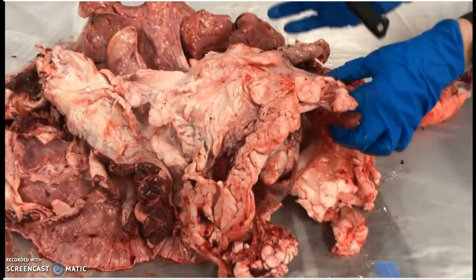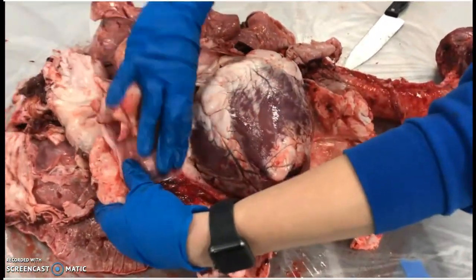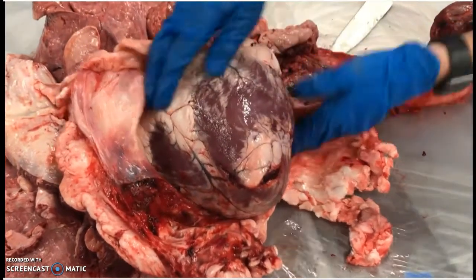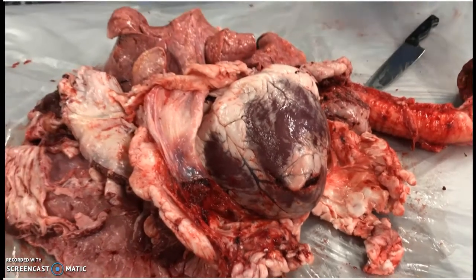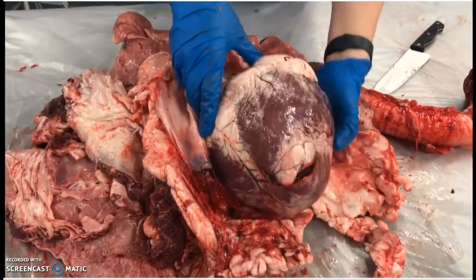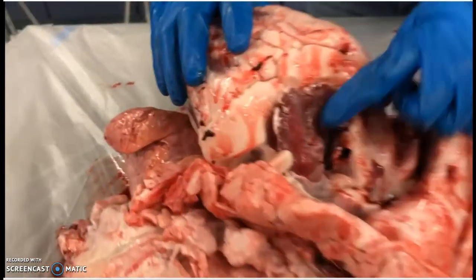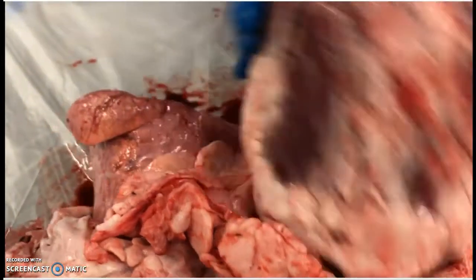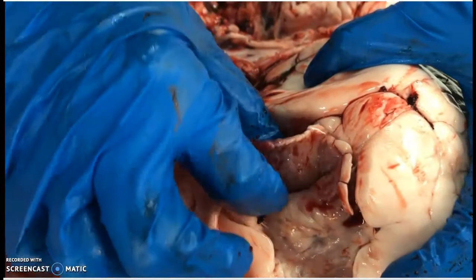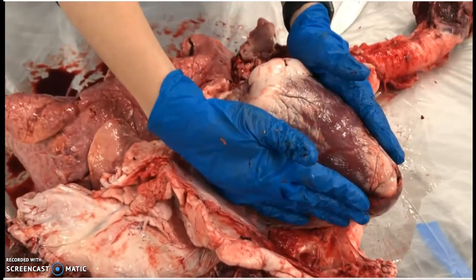You can see the inside of that pericardium around the heart. The big portion of the heart — if you remember, those are the ventricles. This is the big, large, muscular portion. Then towards the top of the heart I have an atrium, and on the other side I have the other atrium. The atria are receiving chambers — they receive blood, they fill up, and then all they have to do is push blood down into the larger ventricles.